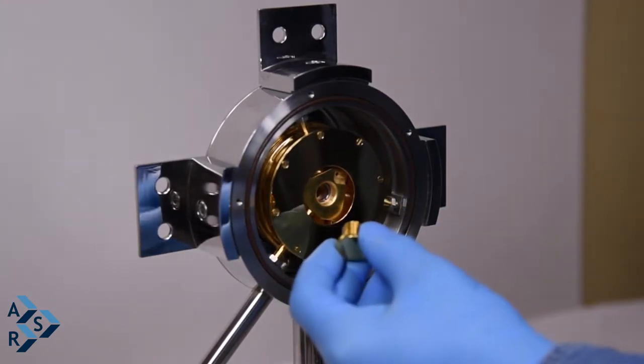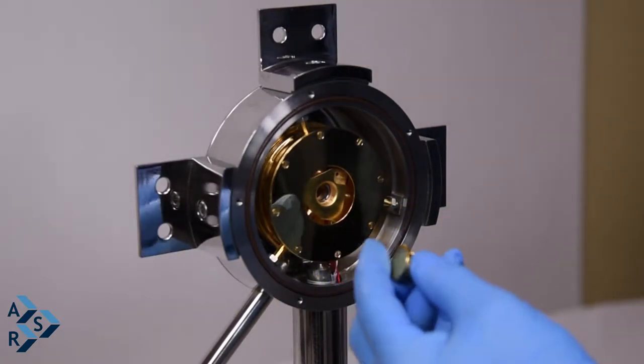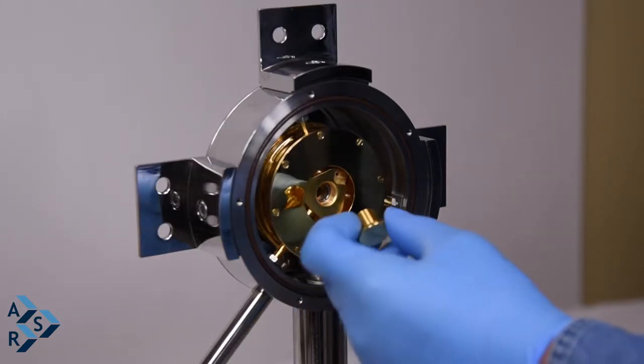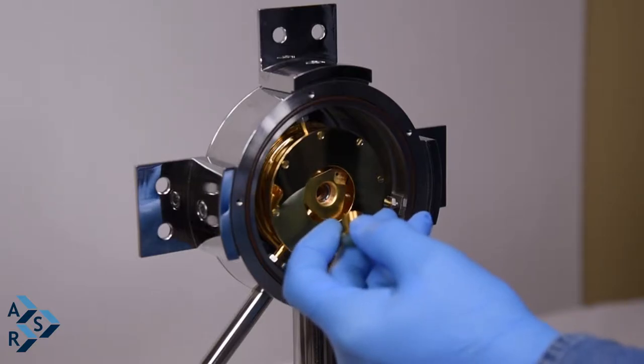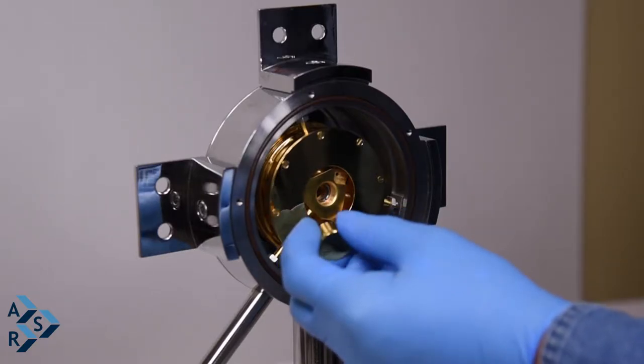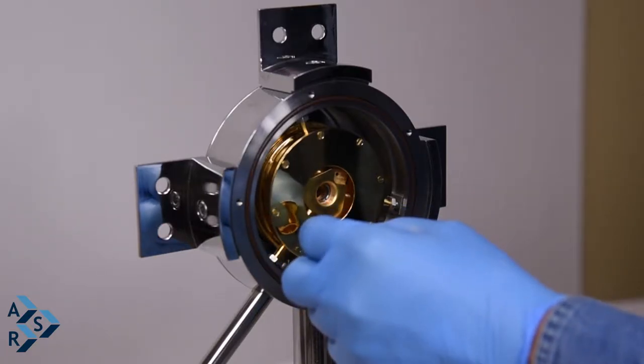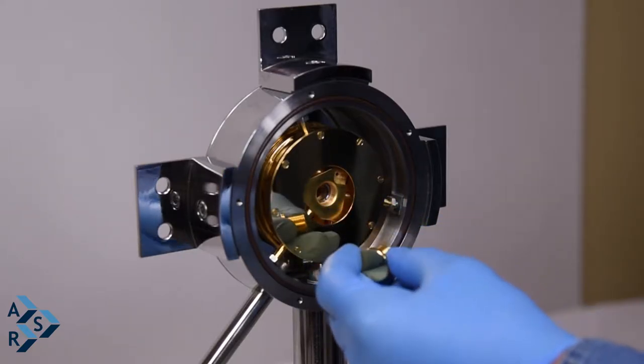Now what you could do, depending on your application, if you feel that you could put a little bit of grease on your threads, it'll give you a little bit better thermal contact. But it's entirely up to you whether you could use grease or not.